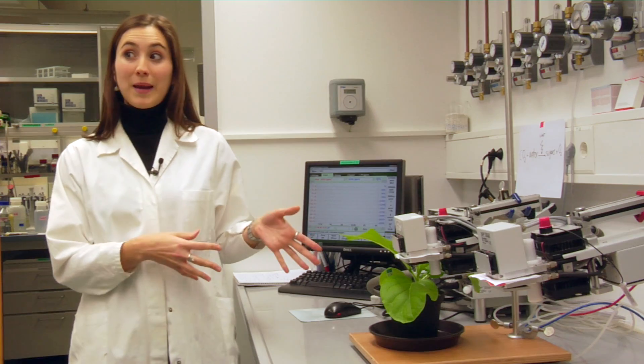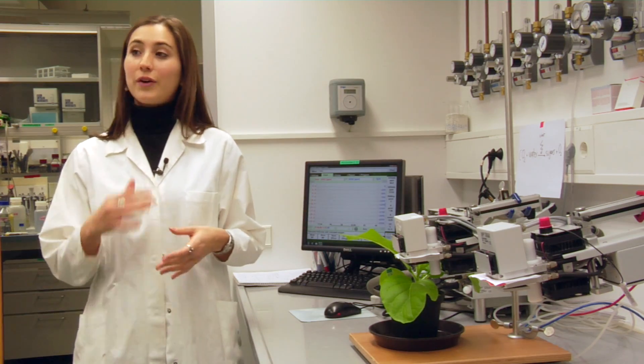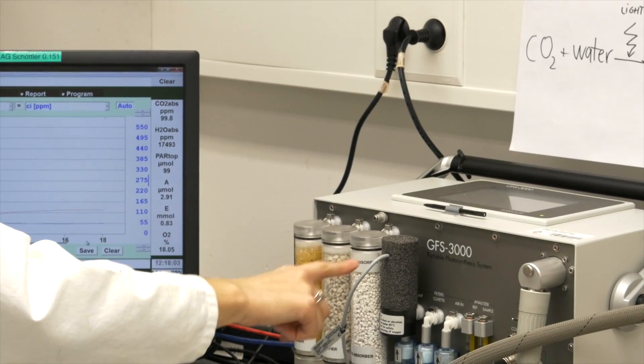Now I want to analyze what the effect is of my gene in these plants, and in order to do so I'm going to measure the photosynthetic rate by measuring gas exchange with this machine.